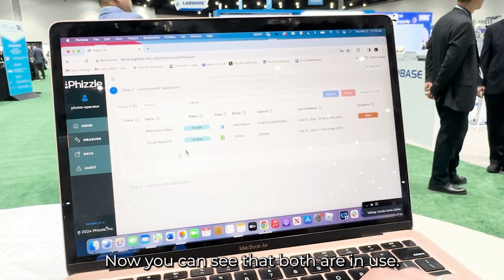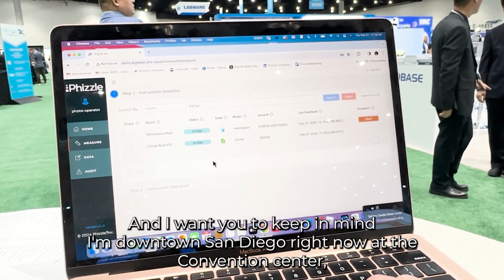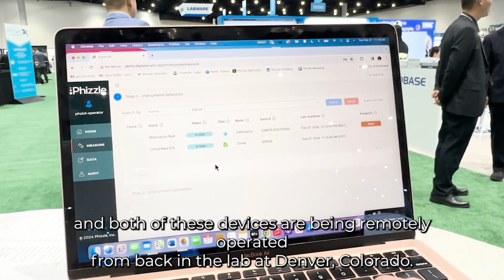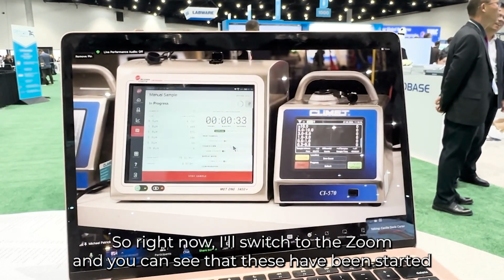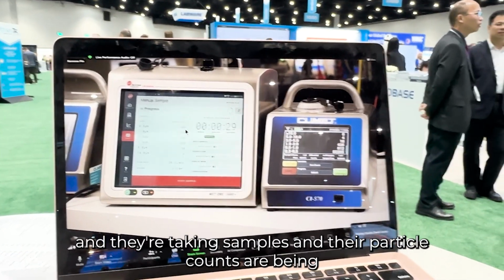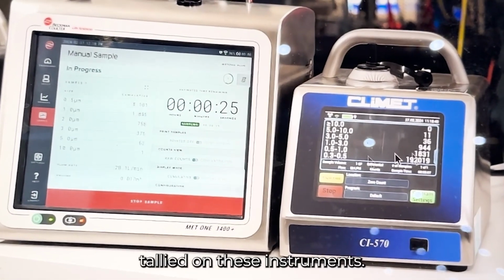Now you can see that both are in use, and I want you to keep in mind that I'm downtown San Diego right now at the convention center, and both of these devices are being remotely operated from back in the lab at Denver, Colorado. There's no one even in the lab right now. So right now I'll switch to the Zoom, and you can see that these have been started, and they're taking samples, and their particle counts are being tallied on these instruments.